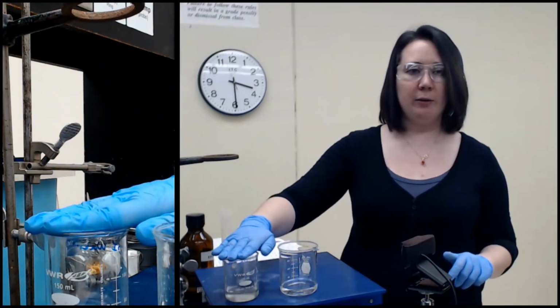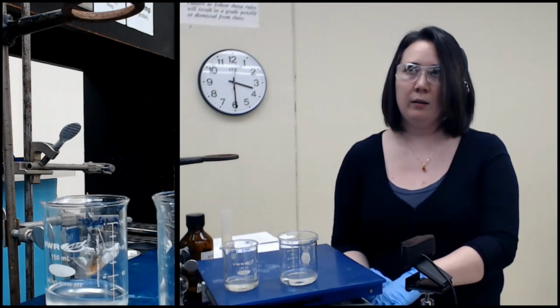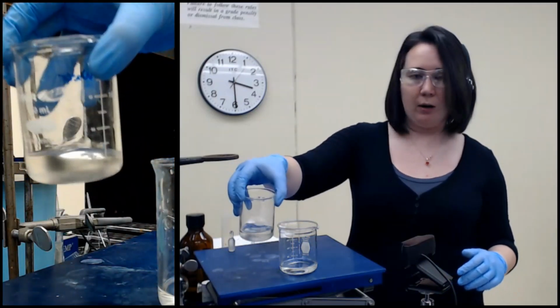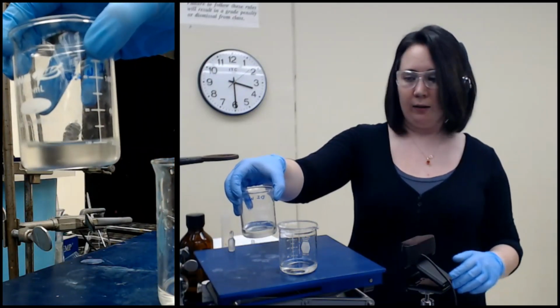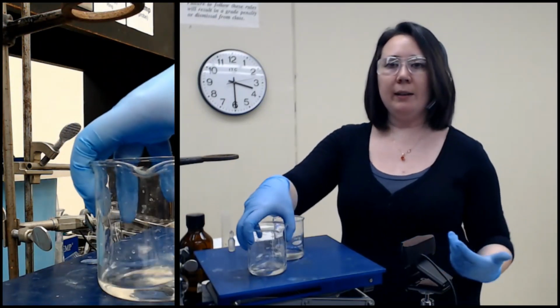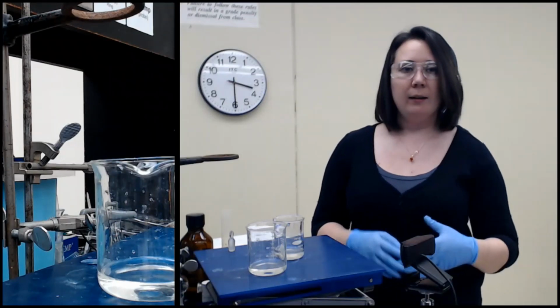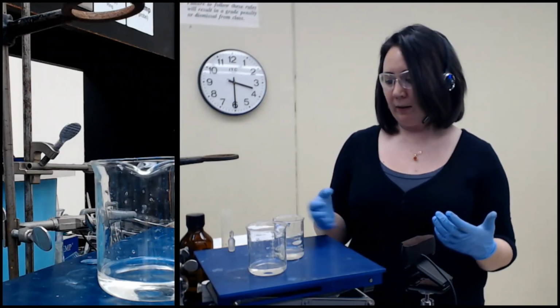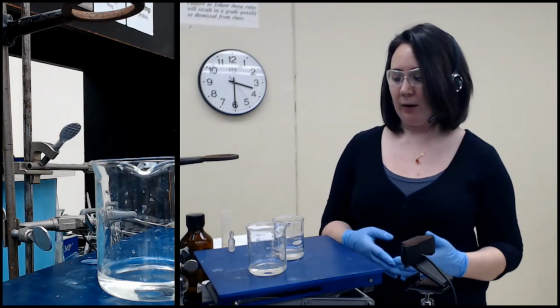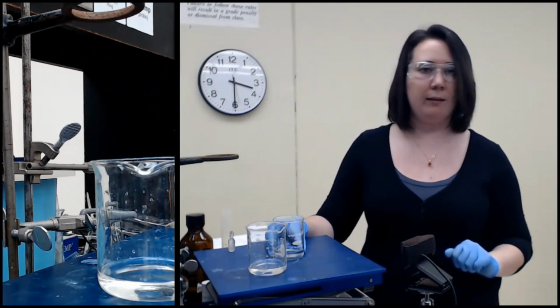This is almost ready. The only thing left in it is the ethyl acetate and a touch of water. So you see it's a bit cloudy, it's not a crystal clear solution, it's a little bit murky. That's because even though water and ethyl acetate are not miscible, that's still looking at their bulk properties. It doesn't mean that on a tiny level, at like a ppm level, there isn't some mixing going on. So what we need to do is get rid of that last bit of water before we can then get rid of our ethyl acetate.